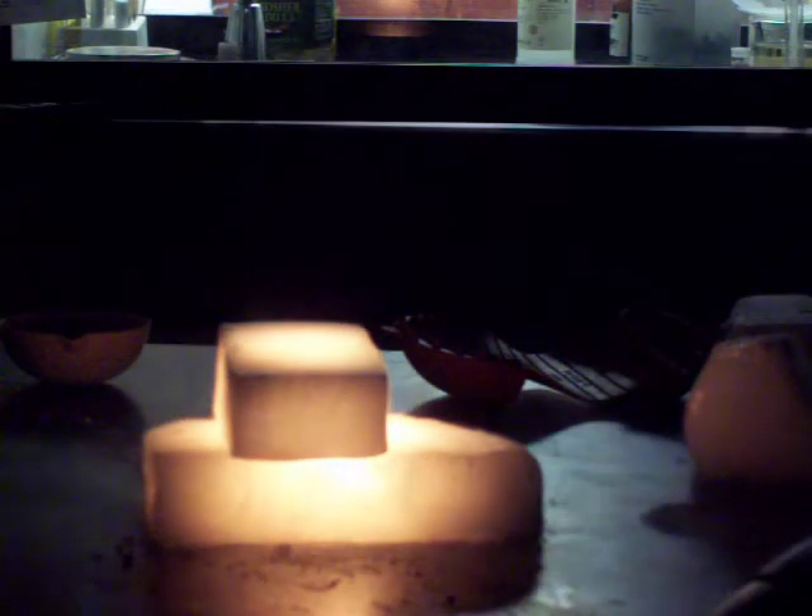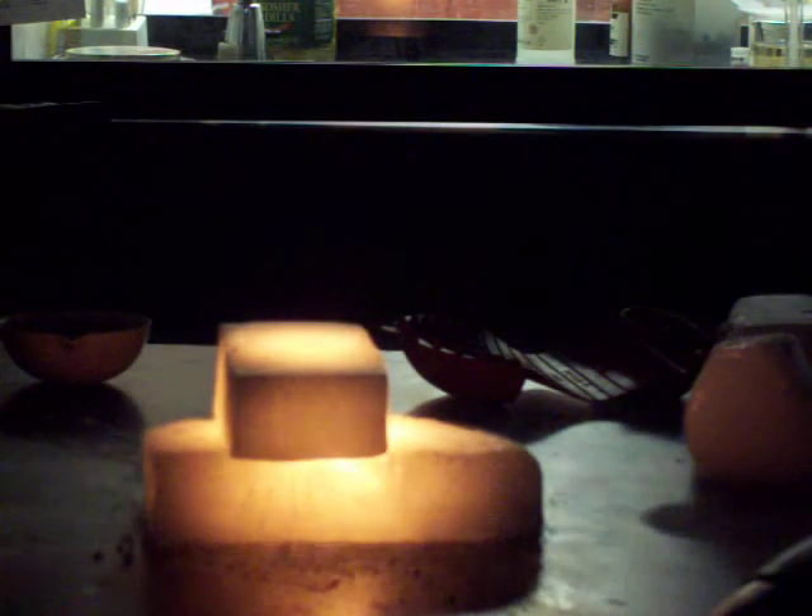That was cool. I didn't turn the flame off there, by the way — it did. Gotcha. It did. It's still going. Do it again. No, as I said, it put out this. It was burning inside of there, inside of carbon dioxide, but this far away — here we're talking what, at least a foot away almost? This Bunsen burner flame was put out by the dry ice here.